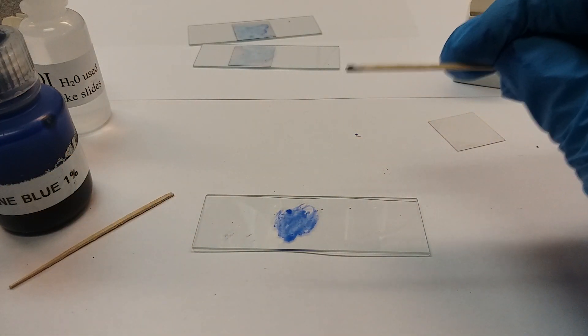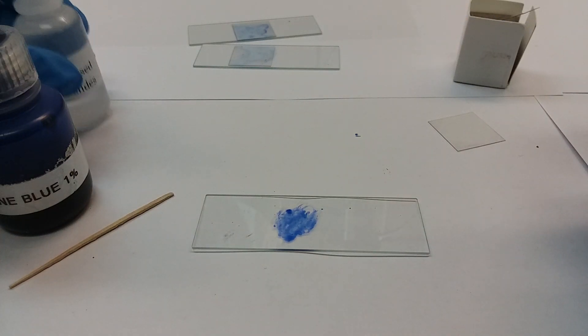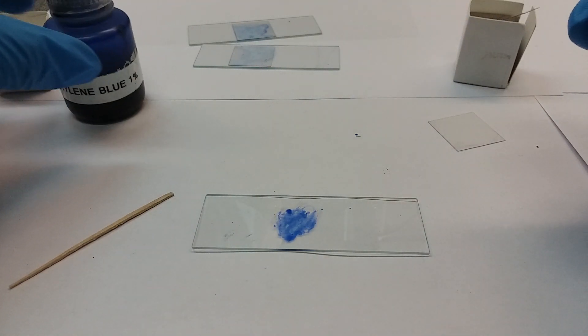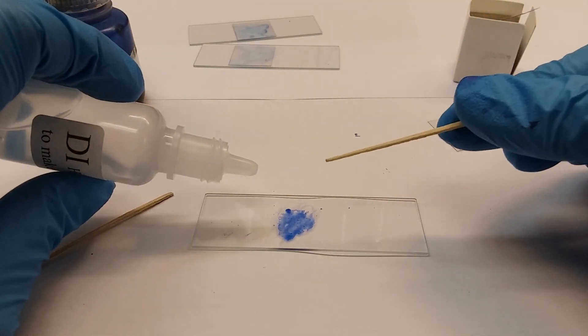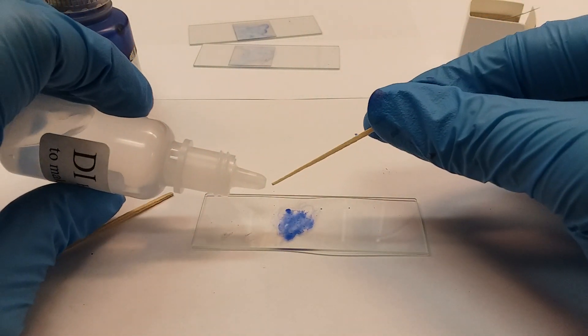Then for the water, now I flip it to the other end. Make sure you're wearing gloves, proper PPE, because you will get dye all over your fingers - I have it all over mine. You're not going to use a whole water droplet either.